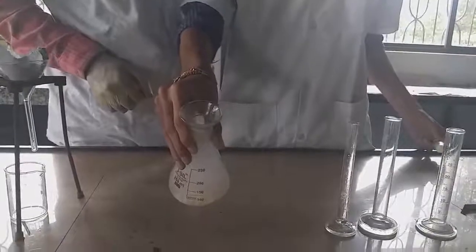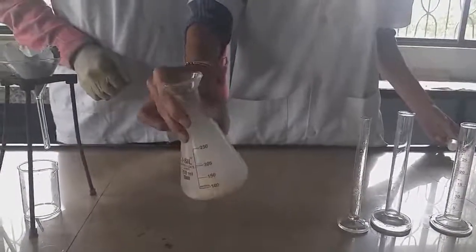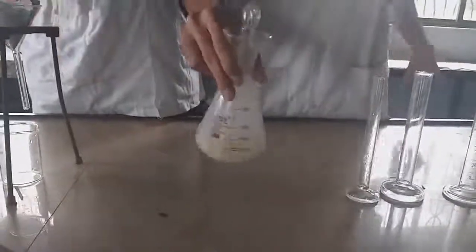As you can see, the crude is getting formed, which shows that the reaction between aniline and benzoyl chloride is forming the benzoanilide. Continue the process until the pungent smell of benzoyl chloride is completely removed. After vigorous shaking, take the conical flask for the filtration process.